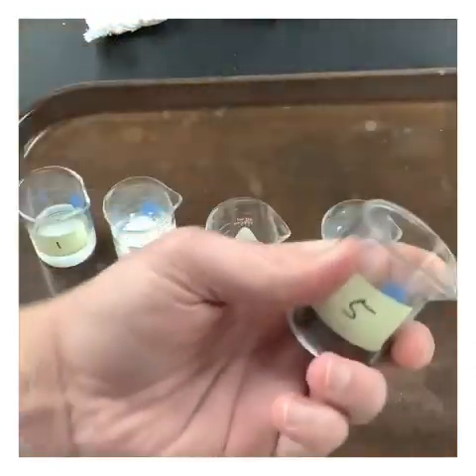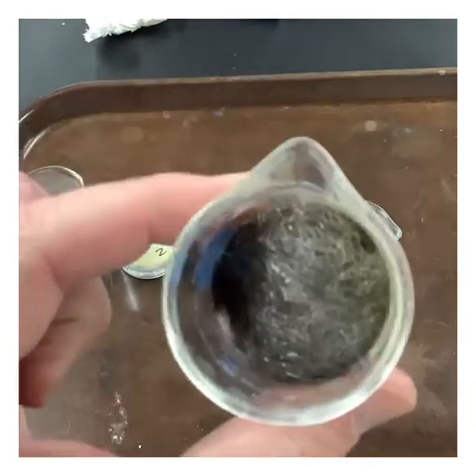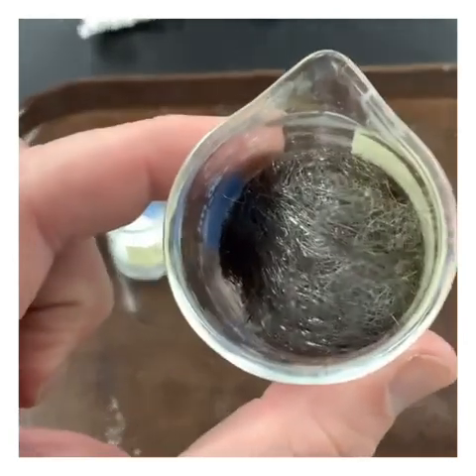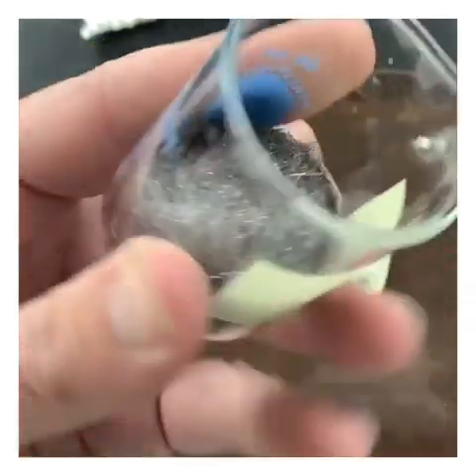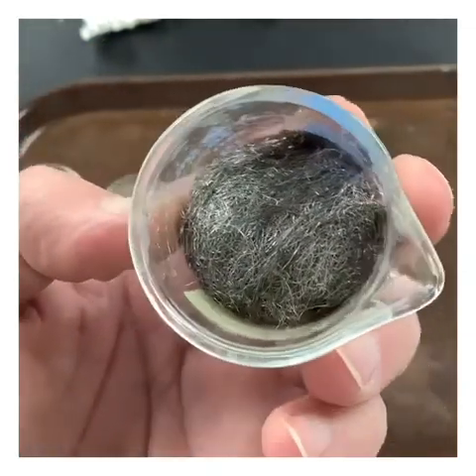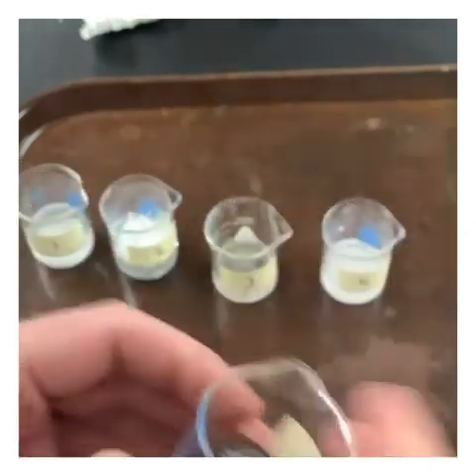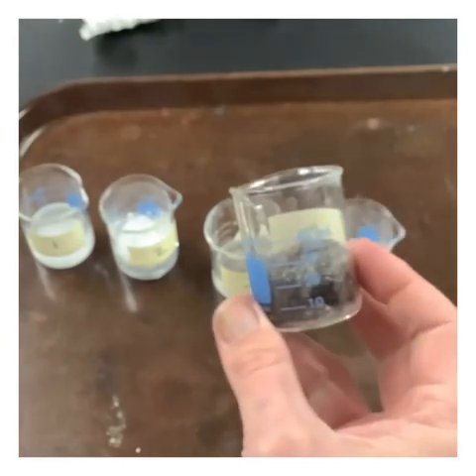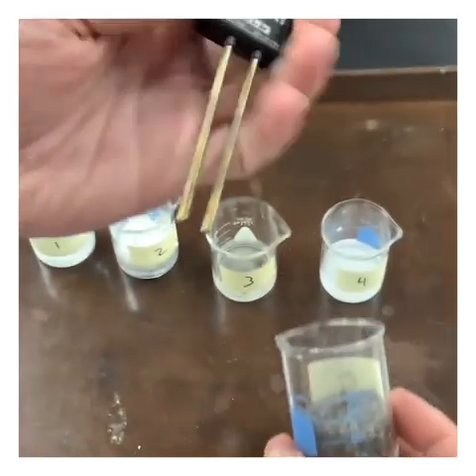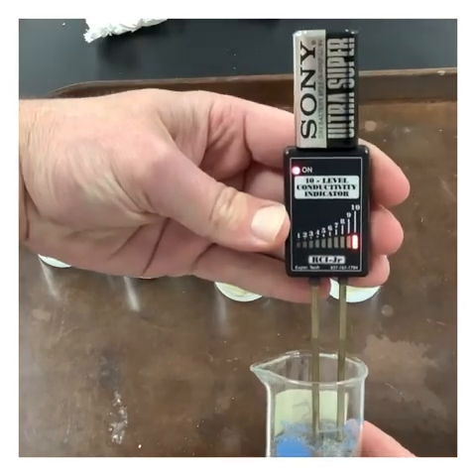All right, we get to number 5. So for number 5, we've got this stuff. And we're going to go ahead and test its conductivity as a solid. So this one is the best, right?